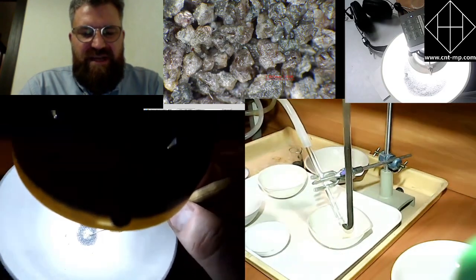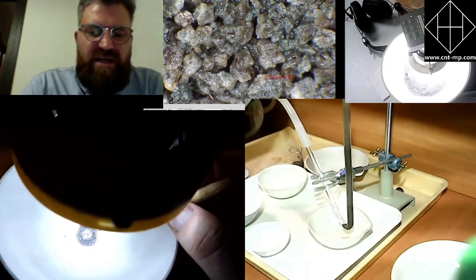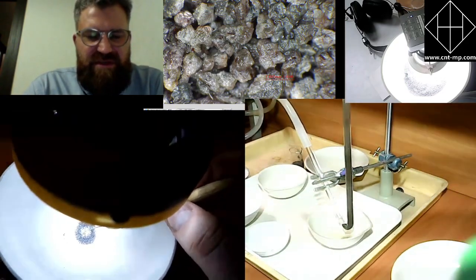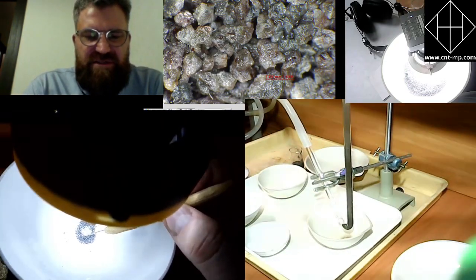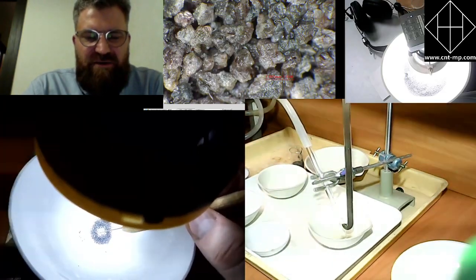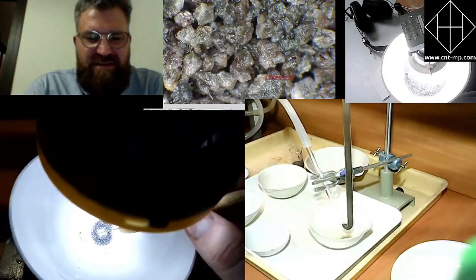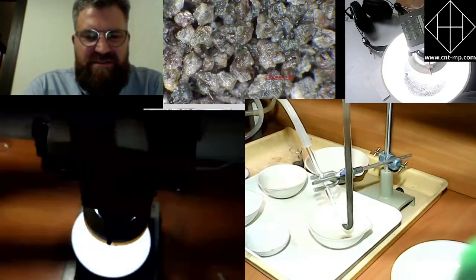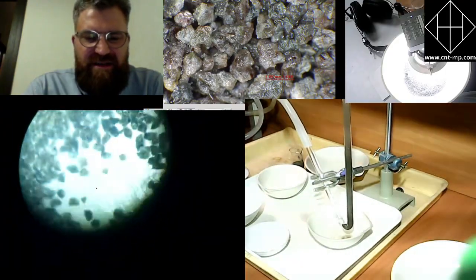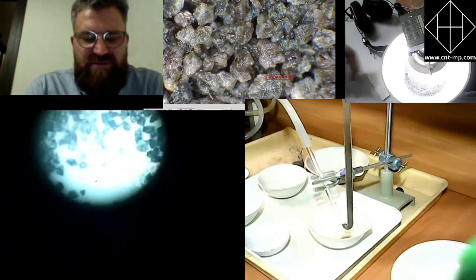So this is the hand picking process. Usually it's done with a needle and a little bit of fat, you know. You touch your face usually with the tip of the needle. That becomes gluey with the fat from your skin, and it's easy to capture grains with that needle from then on, and transport them from one dish to the other.